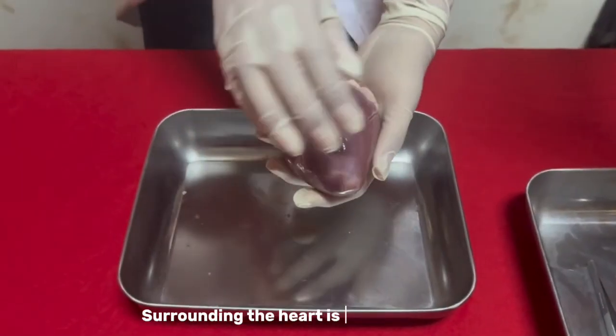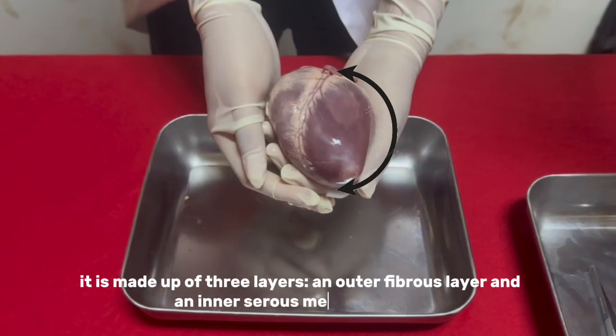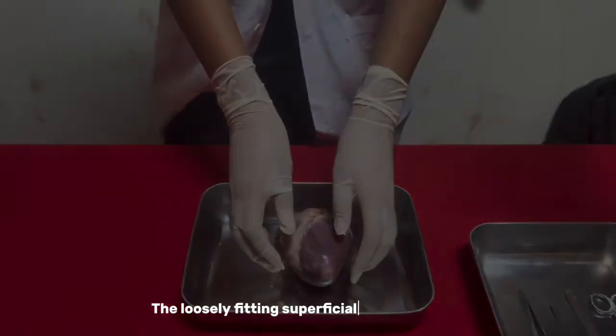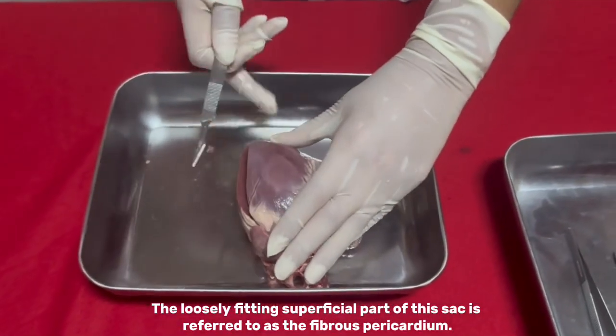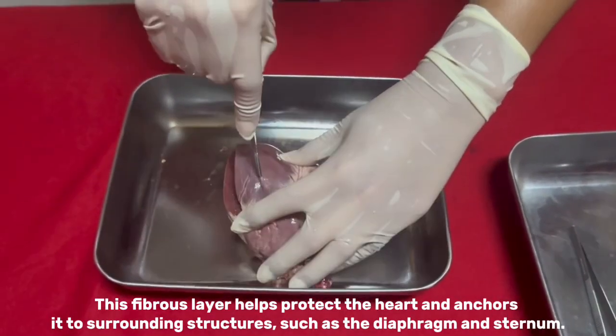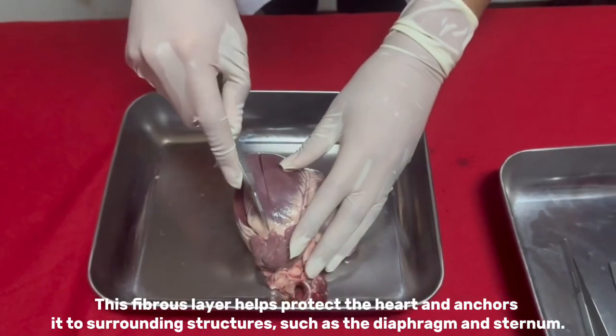Surrounding the heart is the pericardium. It is made up of 3 layers, an outer fibrous layer and an inner serous membrane pair. The loosely fitting superficial part of this sac is referred to as the fibrous pericardium. This fibrous layer helps to protect the heart and anchors it to surrounding structures, such as the diaphragm and sternum.